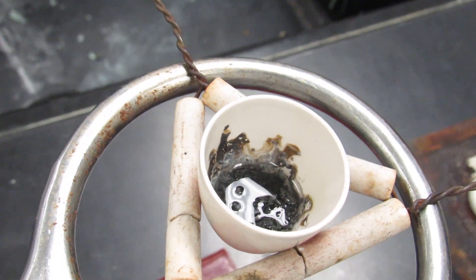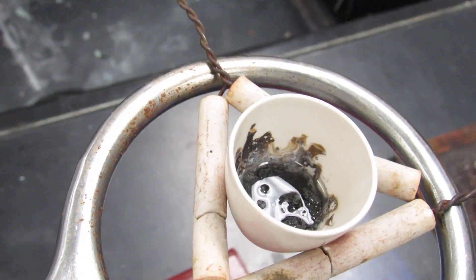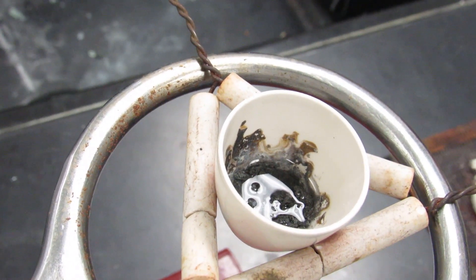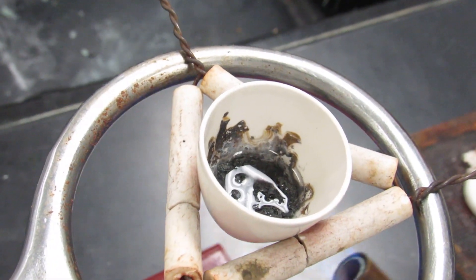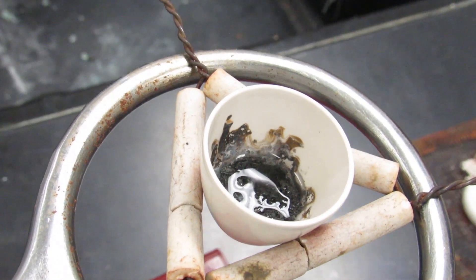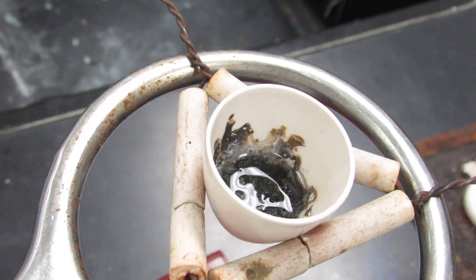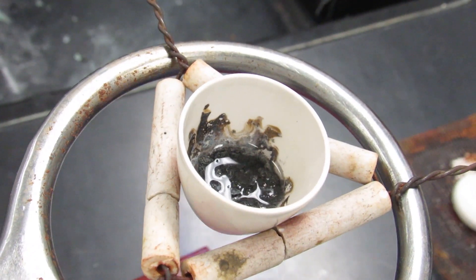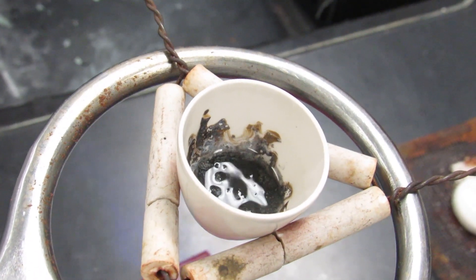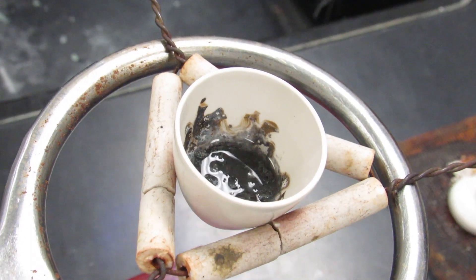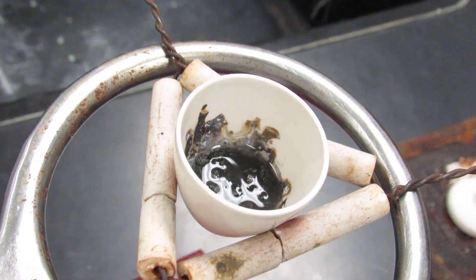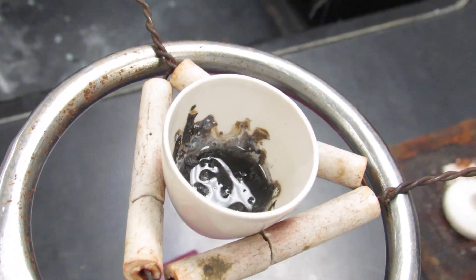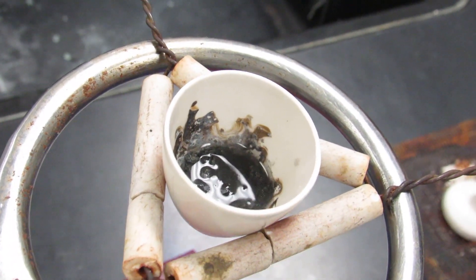This part takes a bit of time. You can see how you've got a little bit of bubbles forming. Just a tiny amount. Slow and steady. Continue to do this.